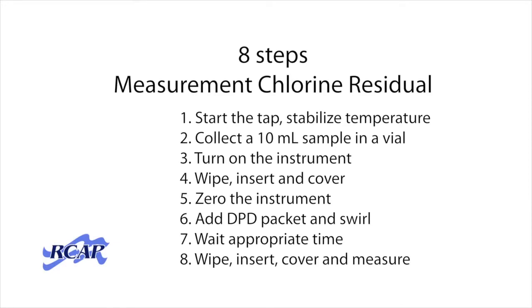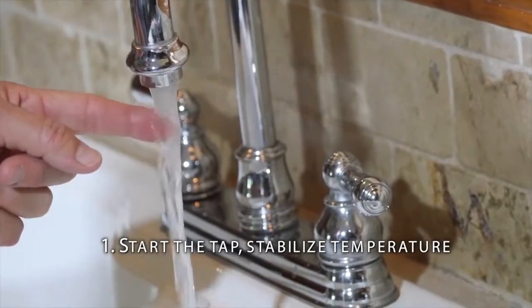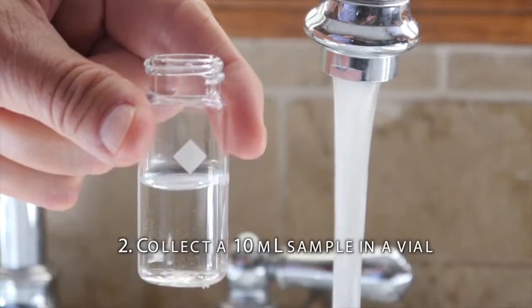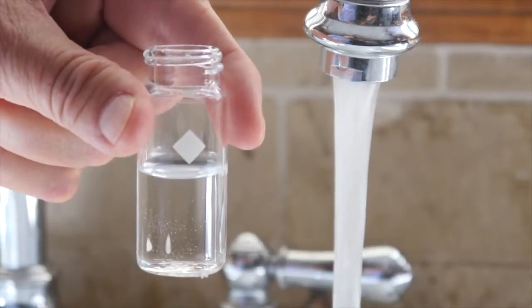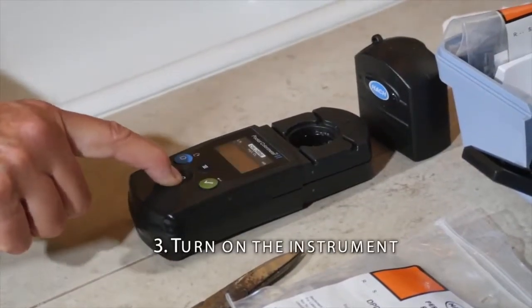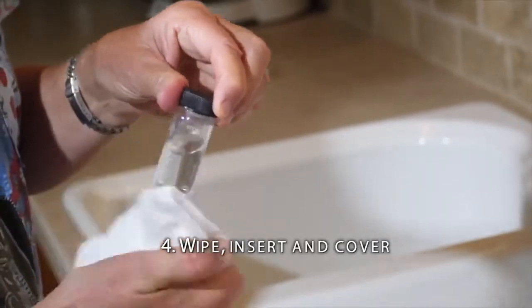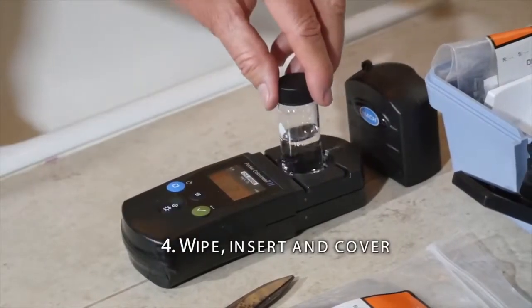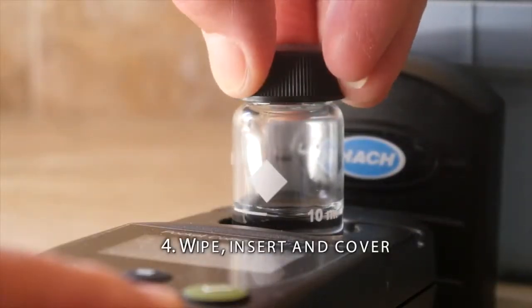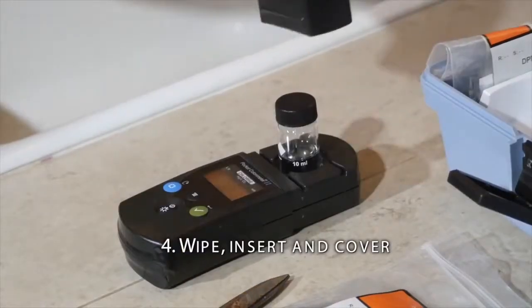There are 8 steps. Start the tap and wait for the temperature to stabilize. Collect a 10 milliliter sample in a vial. The 10 milliliter mark is on the vial. Turn on the instrument. Wipe off the vial with a lint-free cloth or chem wipe. Insert the vial, lining up the diamond. I point the diamond directly toward me, but it doesn't matter as long as you line it up consistently. Cover the sample.